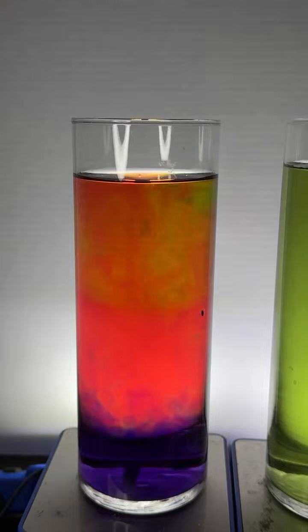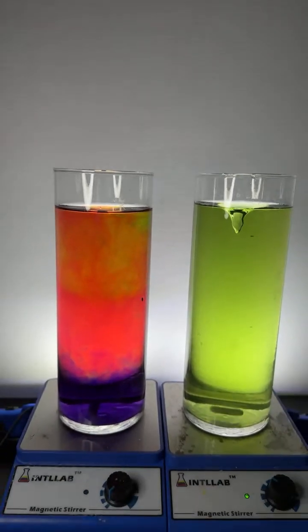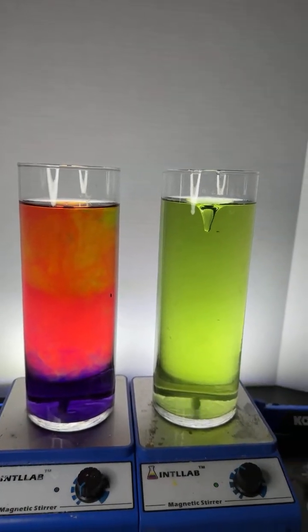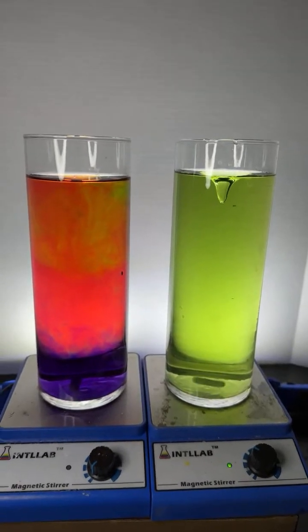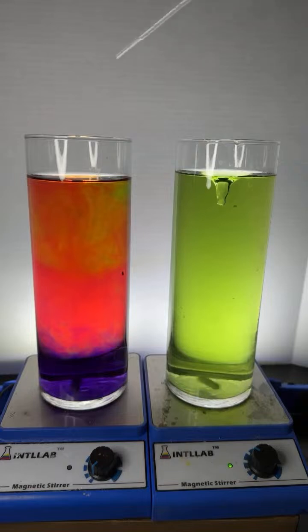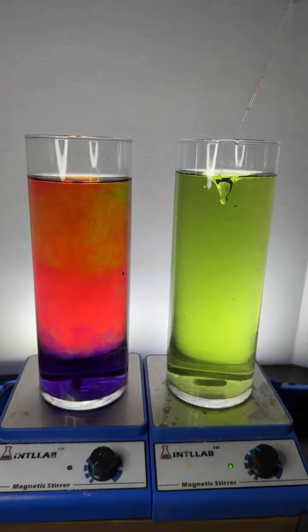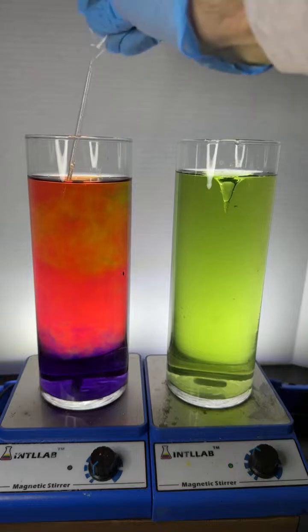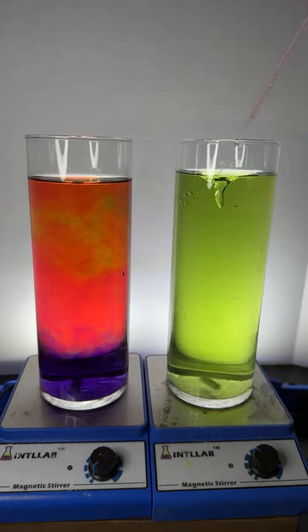Can I add red to the green? Sure, Samurai, let's do it. Yeah, you can think of it that way, administrator. Here we go. We're going to add a little bit of the red to the green. I don't think it's going to be acidic enough. Yeah, the concentration is way too low for there to be any impact.